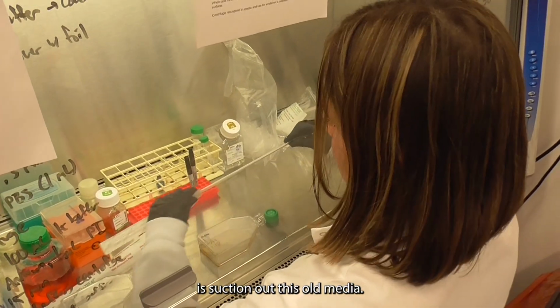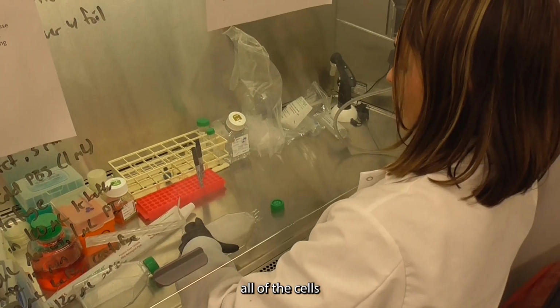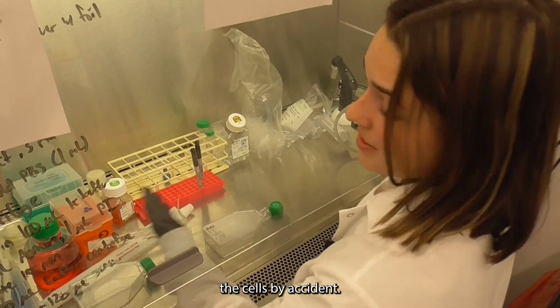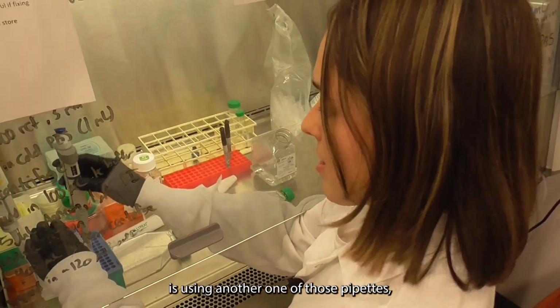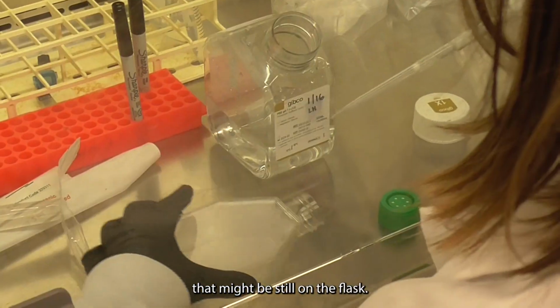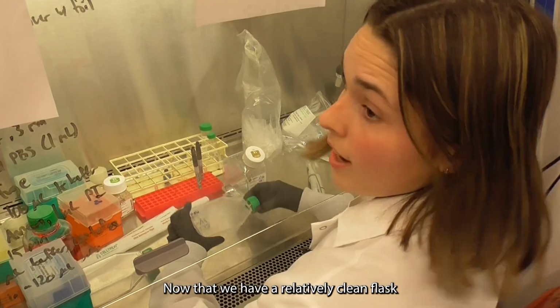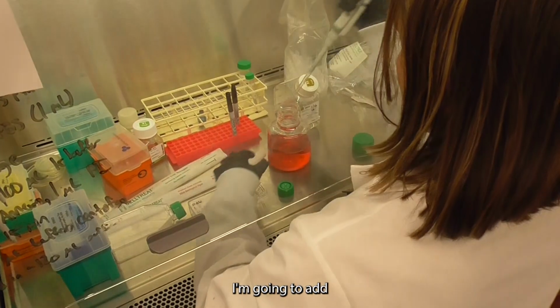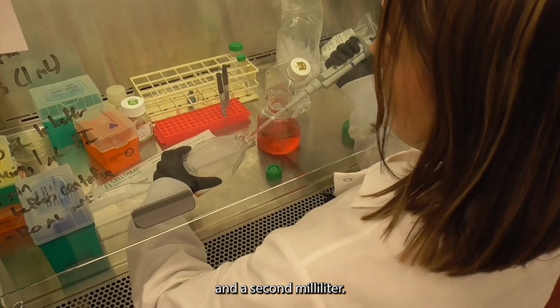The first thing I'm going to do is suction out this old media. This cell line in particular, all of the cells adhere to the bottom of the flask, so I don't have to worry about suctioning out the cells by accident. The next thing I'm gonna do is using another one of those pipettes, I'm gonna wash away any extra debris or dead cells that might be still on the flask. And again, I'm just going to suction it out. Now that we have a relatively clean flask, just full of cells, I'm going to add just a little bit of cell media. This is 1 milliliter and a 2nd milliliter.